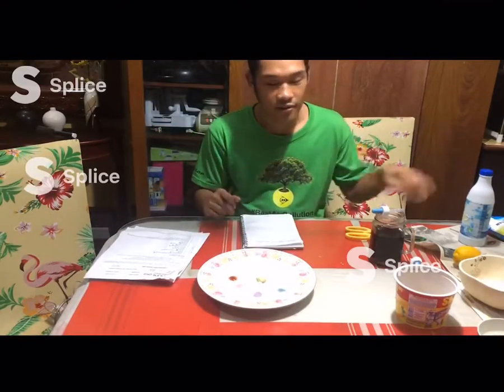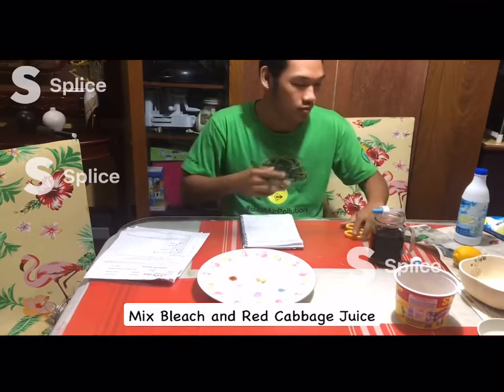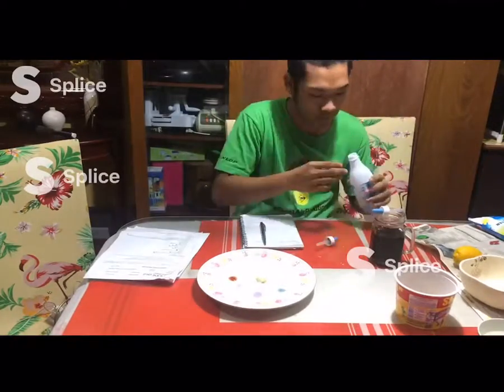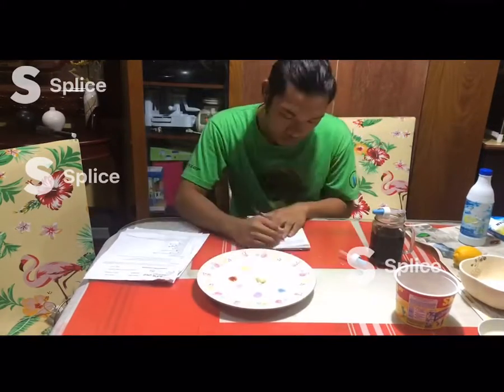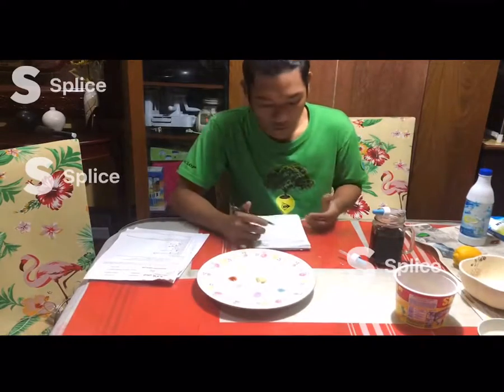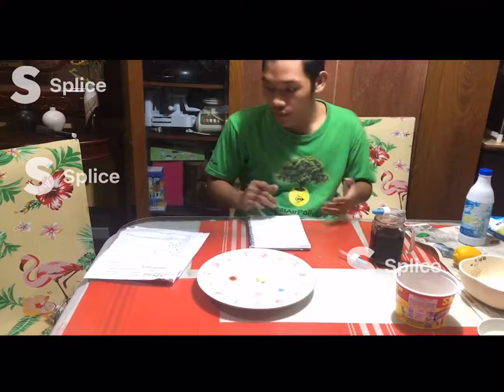So now, I will mix bleach and the red cabbage juice. I observe when I mix the bleach and the red cabbage juice, it turns yellow. And that's it.